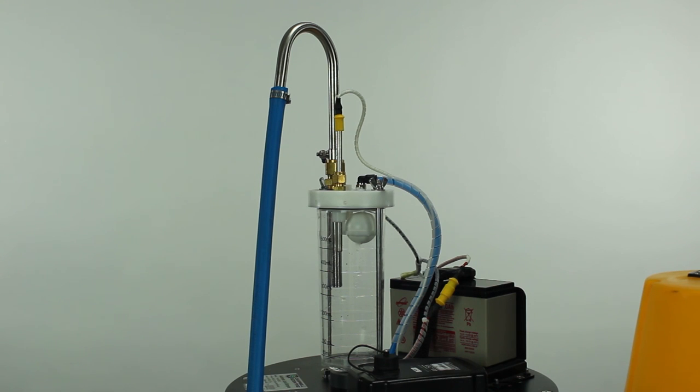Once you hear it click, the distribution arm has moved from bottle position one to bottle position two.